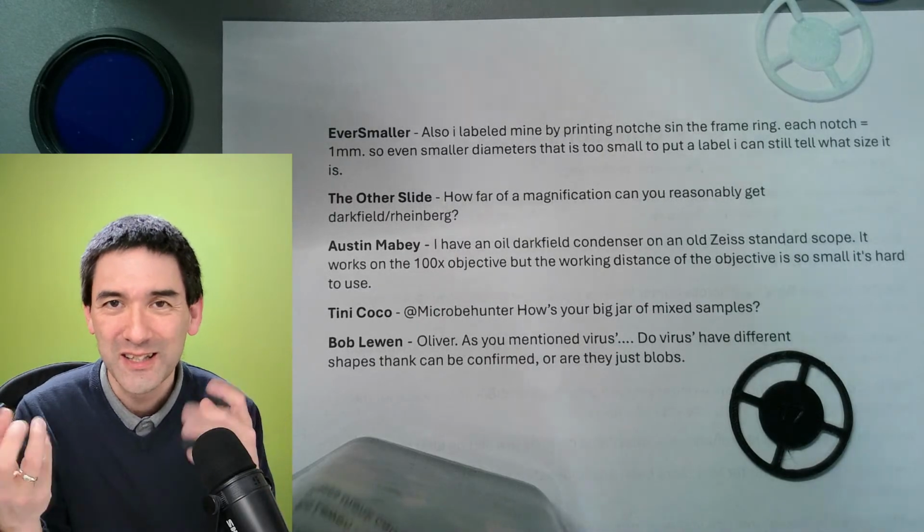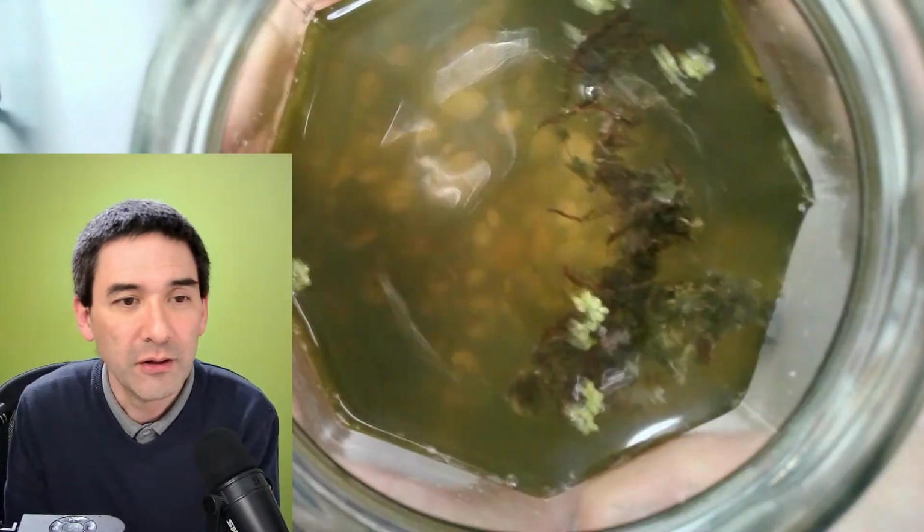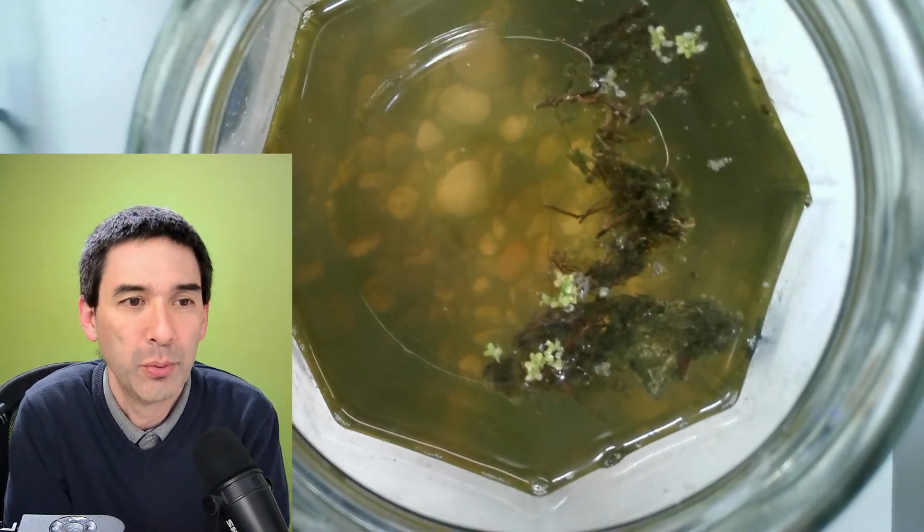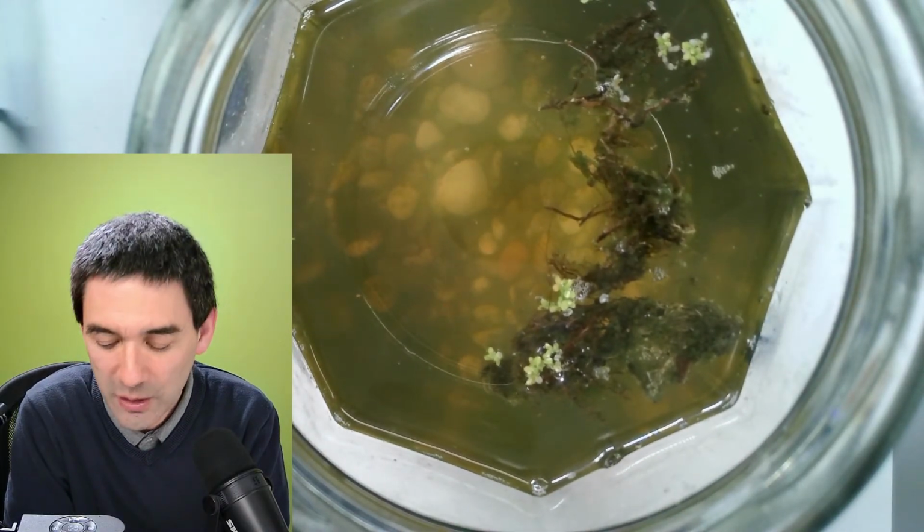Yeah, so that's a little bit the interesting thing here. This is how it looks. I think two weeks ago or so, we poured everything together, and this is how it looks.